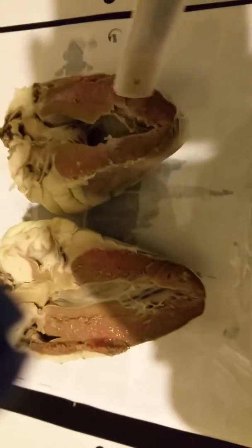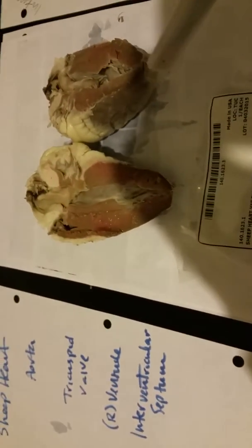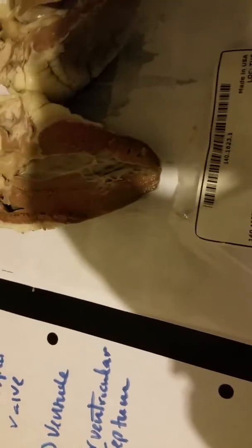The bottom, as we get closer and closer, is the myocardium. Right about here is the myocardium. So then both bottoms, obviously, again, this is the apex and this is the apex. Now let's look at some similarities and some differences. And we'll use our gloves as a pointing device.